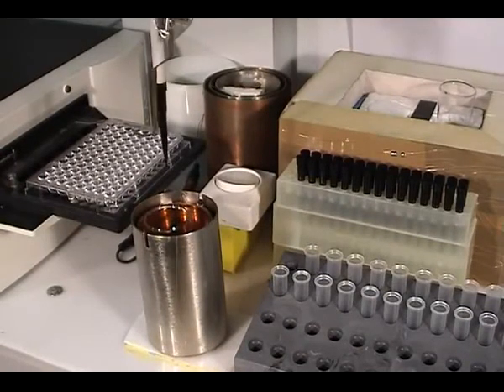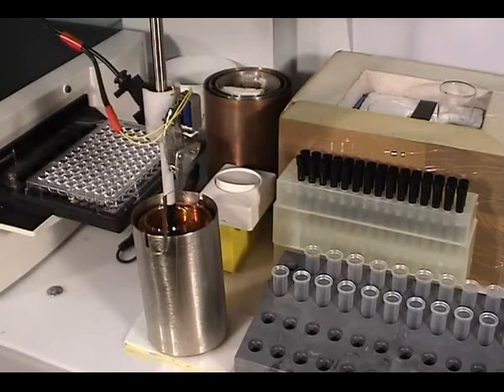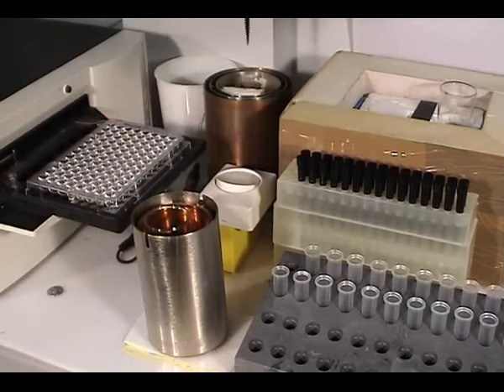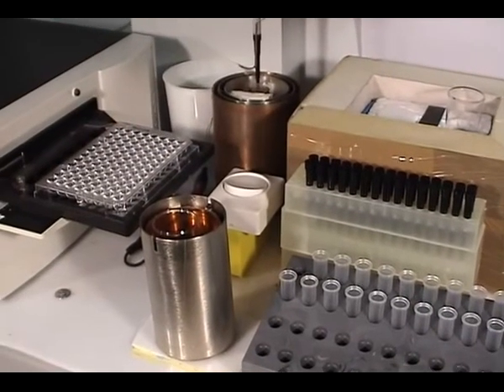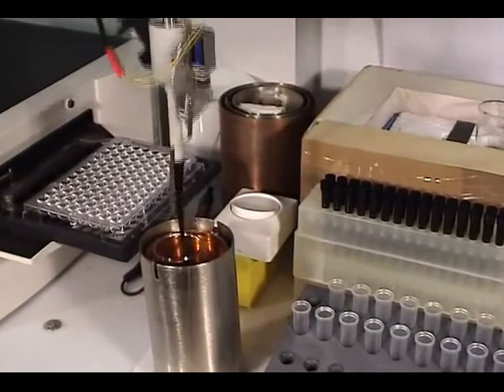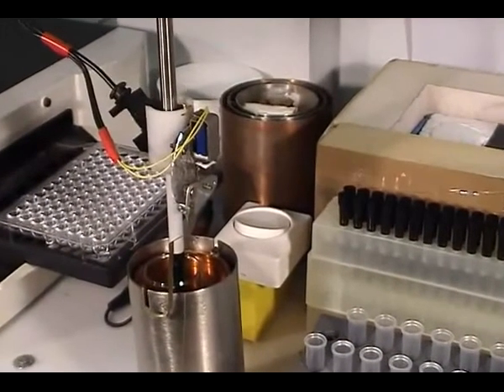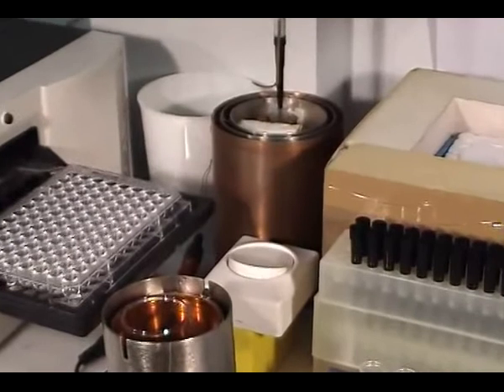Then it will get water, add it to this tube, and then a second time, a second aliquot of water is added to the tube.